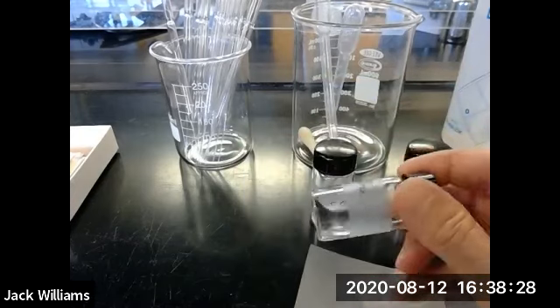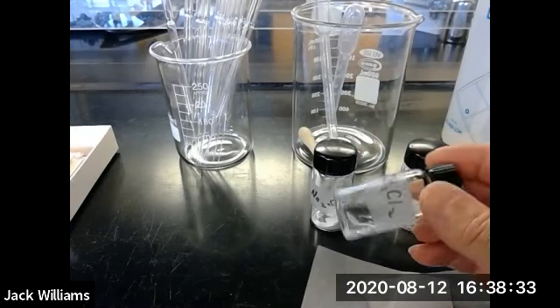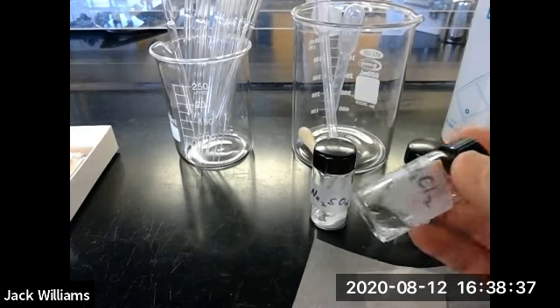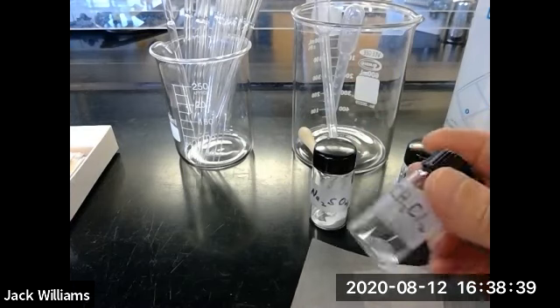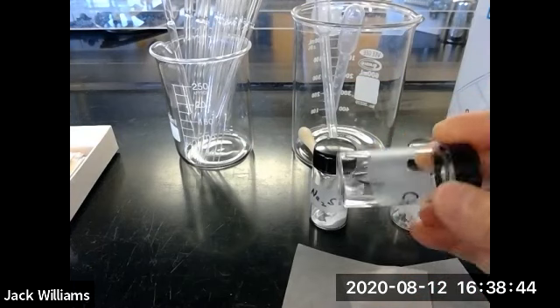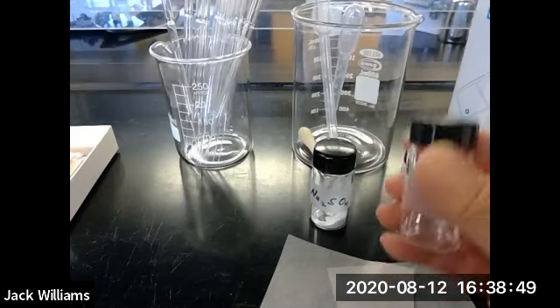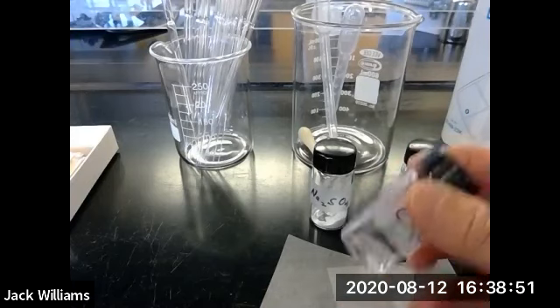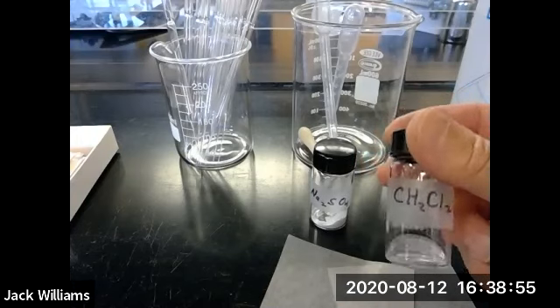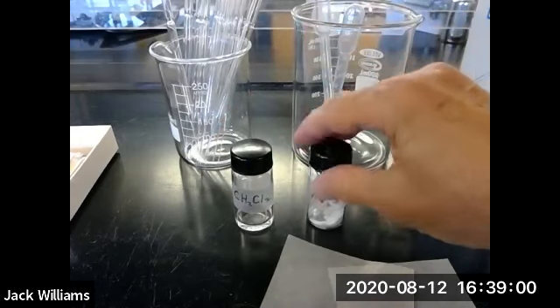This is the liquid we're going to use. It's very volatile. It's methylene dichloride. It is also slightly toxic. You don't want to be swallowing this or inhaling it. We'll use it in the hood. Because of its volatility, if you accidentally leave it open, if you leave the lid off after you use it, it's going to evaporate. Same thing with your sample. So make sure that when you use this, you cap the lid after you withdraw a certain amount of the methylene dichloride. CH2Cl2 is the formula for it. Okay, so those are the three compounds that we're going to use.